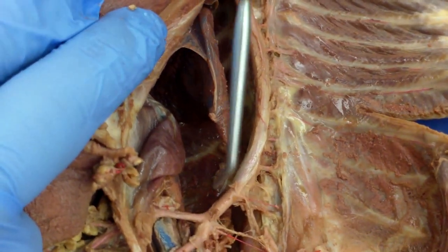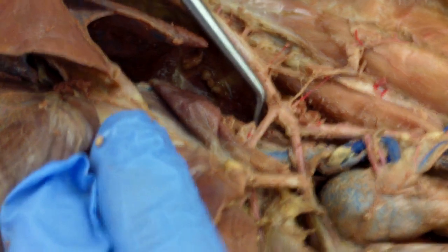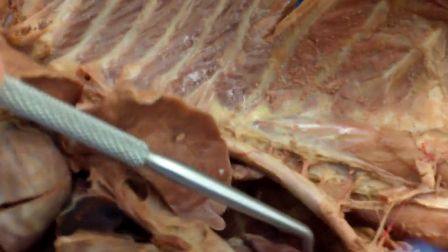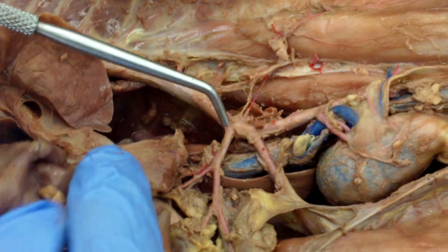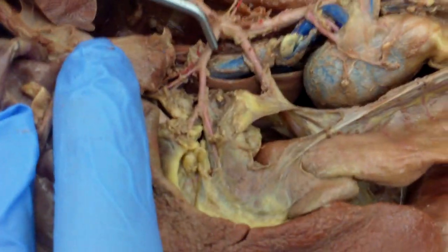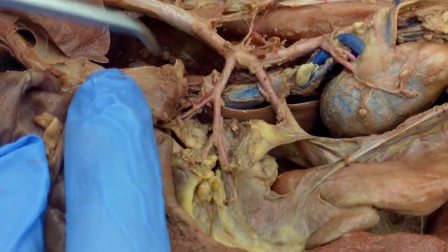And here it branches up into your celiac trunk, which branches into three.